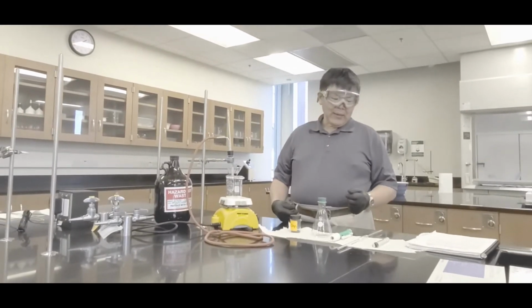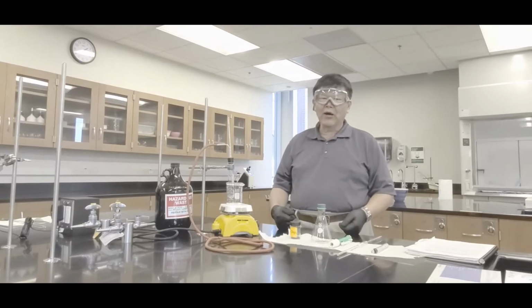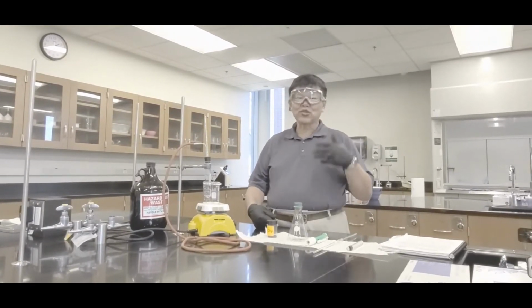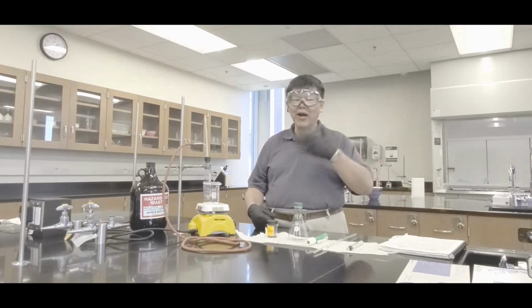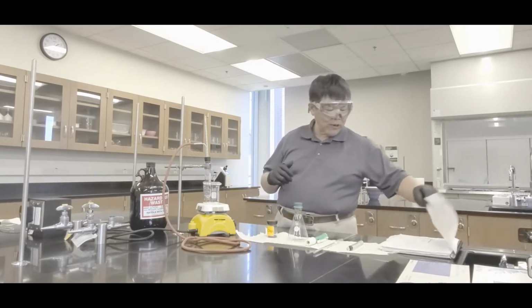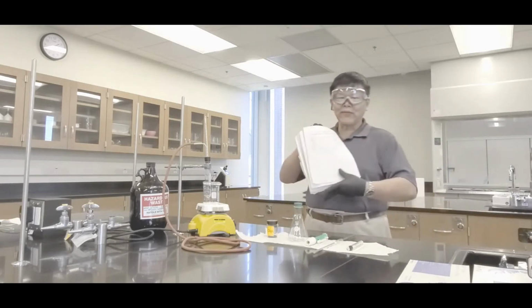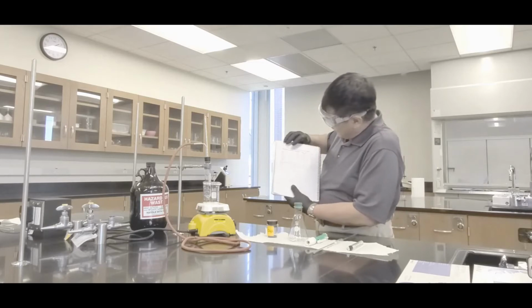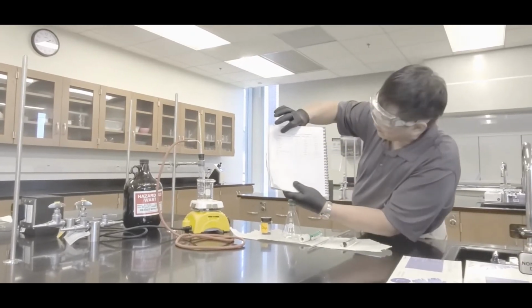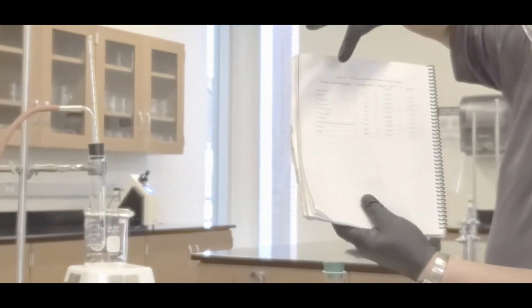Now, what is a physical property? Physical properties are characteristics of a substance that describe how it interacts with its environment without changing composition. And there are quite a few of those. However, today we're going to utilize 3 of those. These are the possible liquids, on page 18 in your lab manual. It's one of these guys, okay?